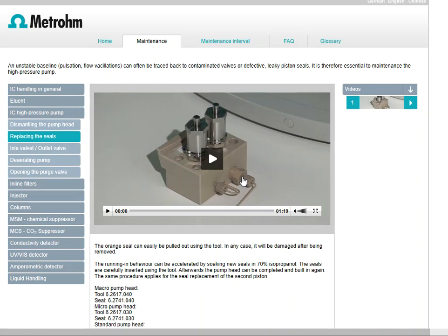Again, those seals are important because they seal the pump off. It prevents the leaks. Mobile phase is coming through there. You've got to make sure that that mobile phase is not leaking out of the system. You want to make sure that everything stays very tight and that the pressure can be built up. And faulty seals, at least, will not allow you to do that.